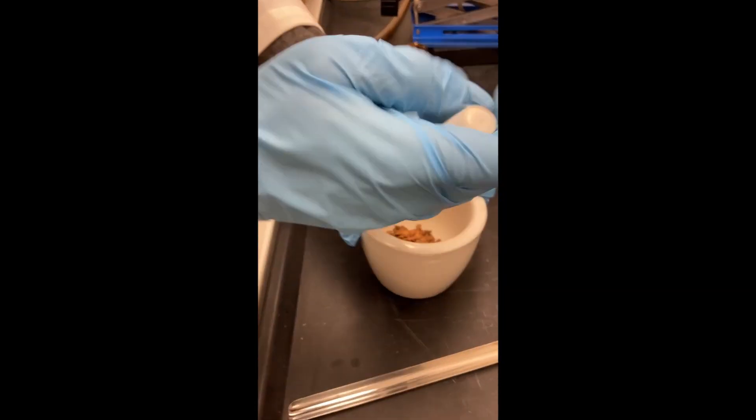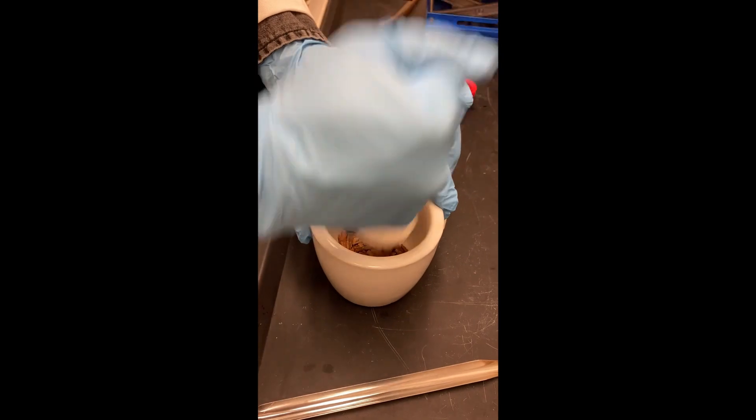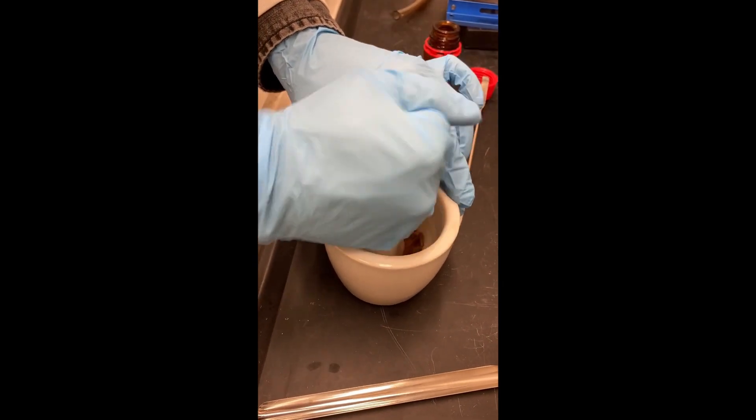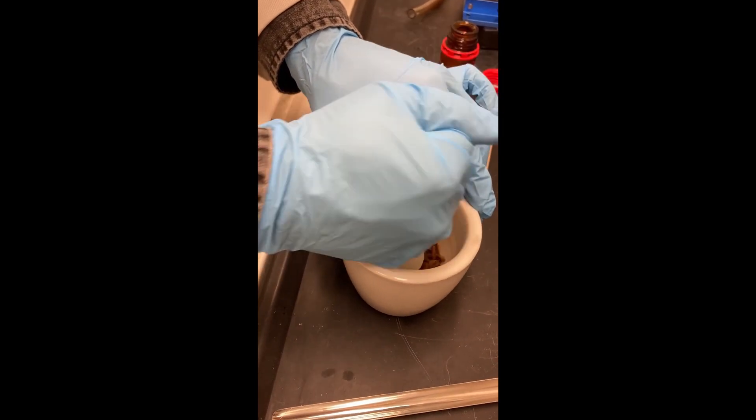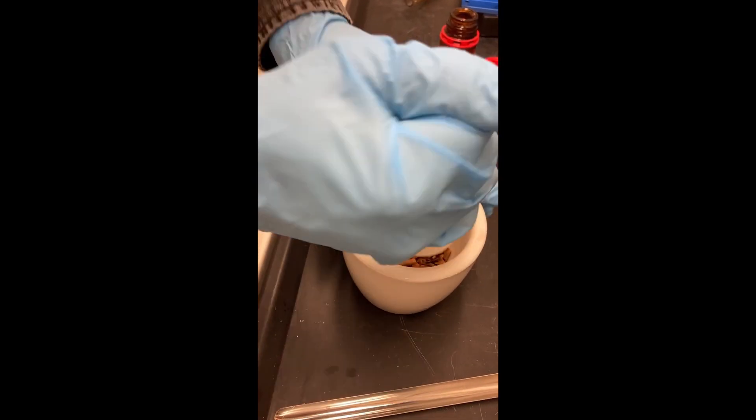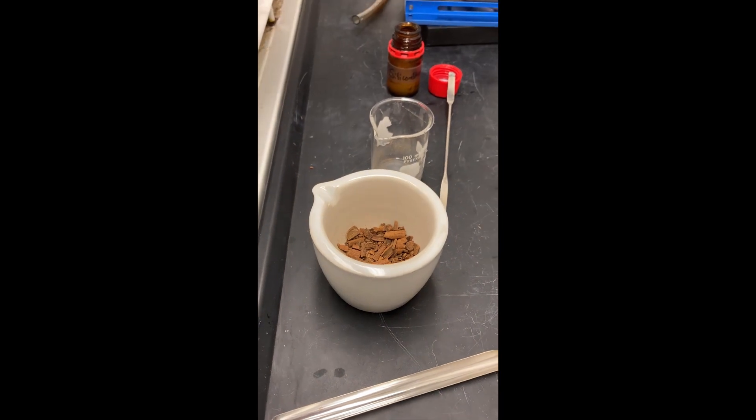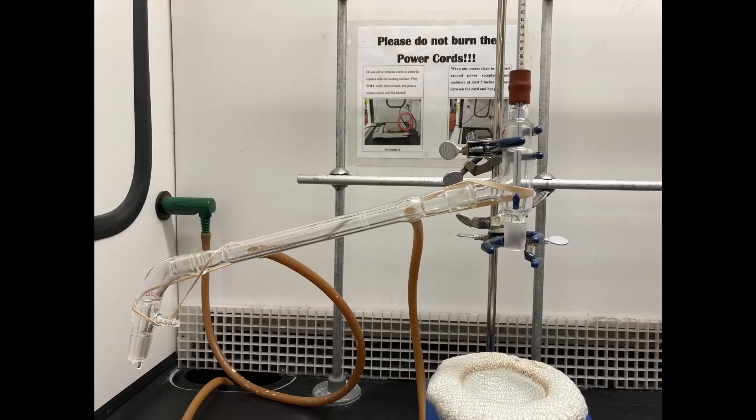We'll use a mortar and pestle to break up the larger pieces. Now we'll assemble our distillation apparatus.